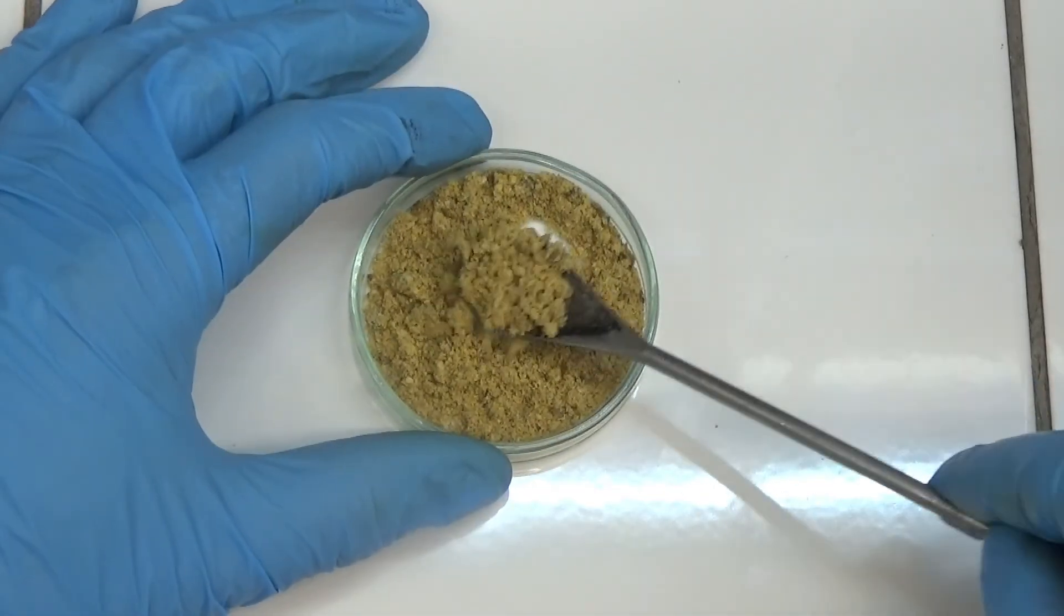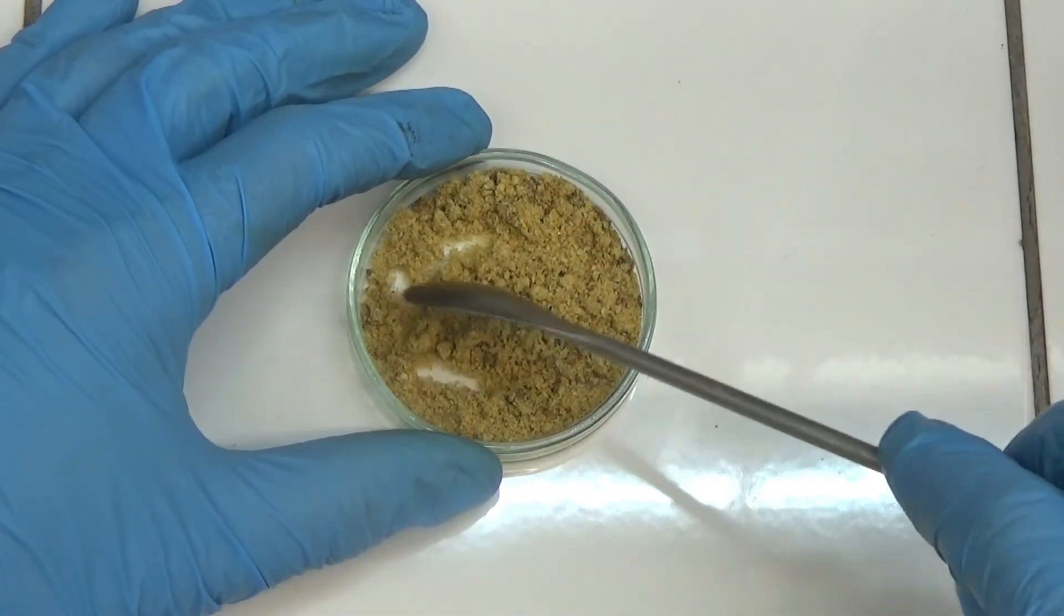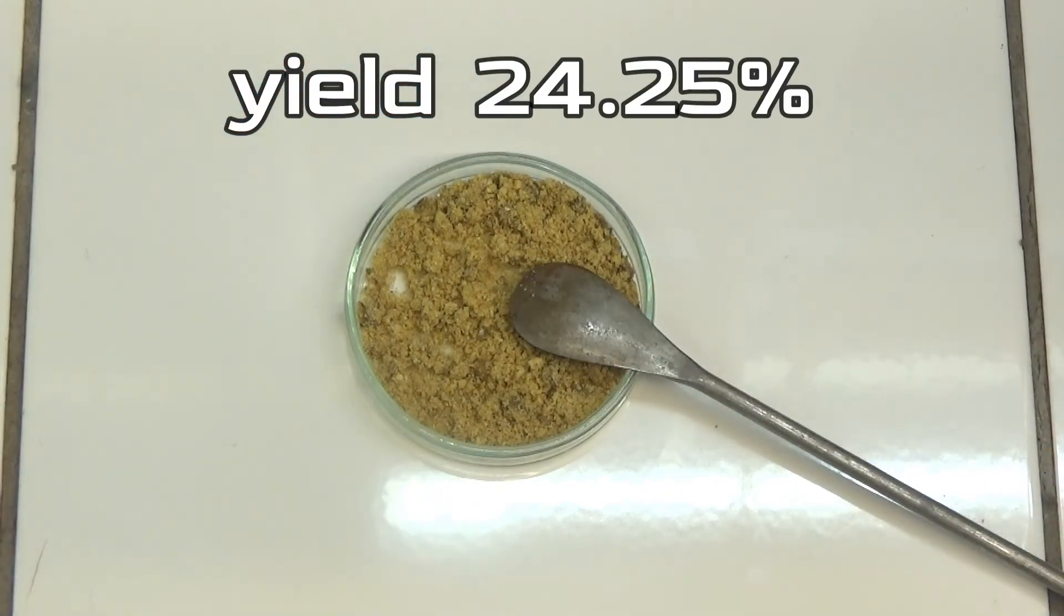The yield of this synthesis depends greatly on the purity of salicylaldehyde. In our synthesis, a yield of 24.25% was obtained.